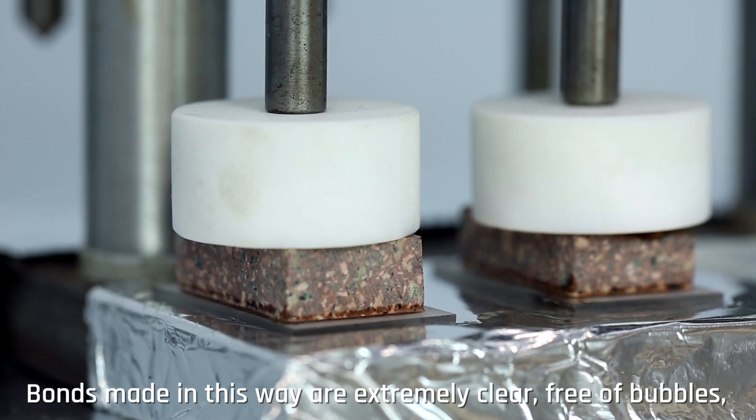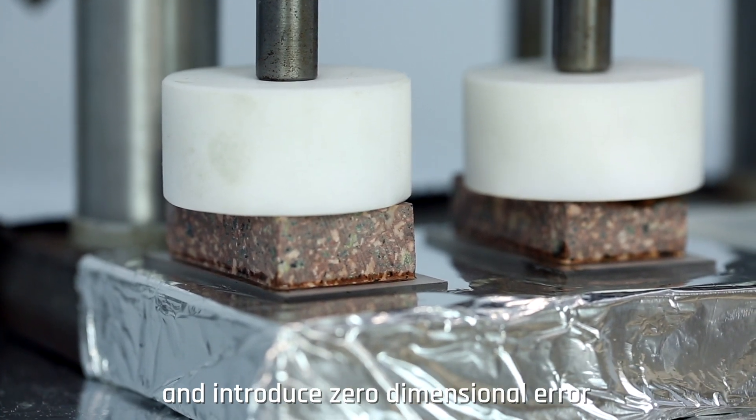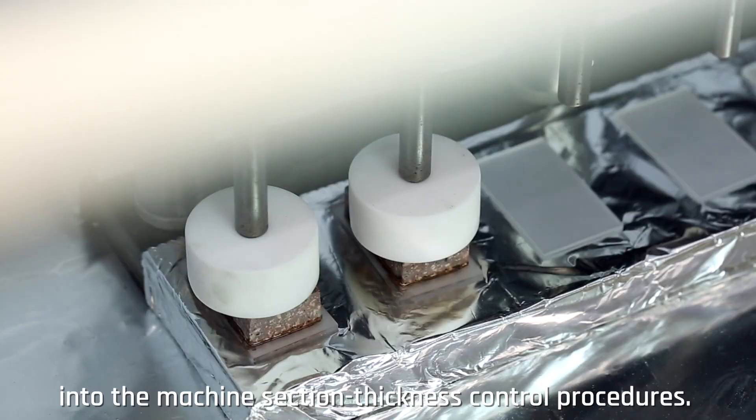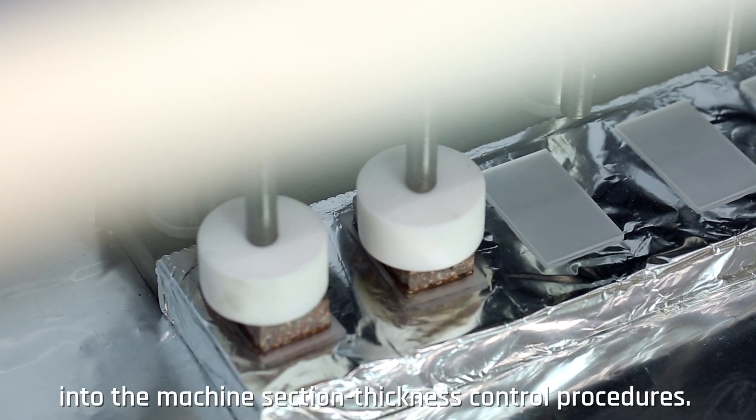Bonds made in this way are extremely clear, free of bubbles and introduce zero-dimensional error into the machine section thickness control procedures.